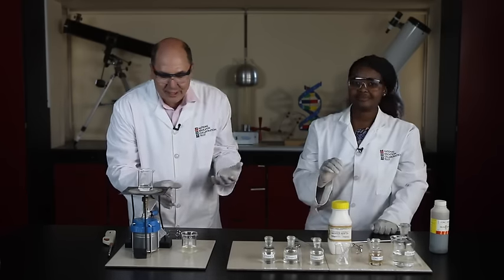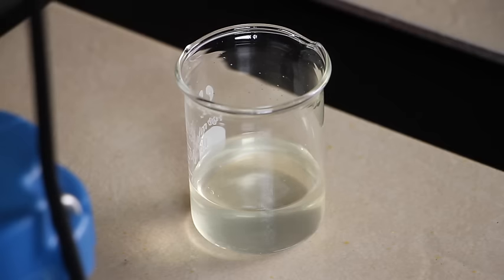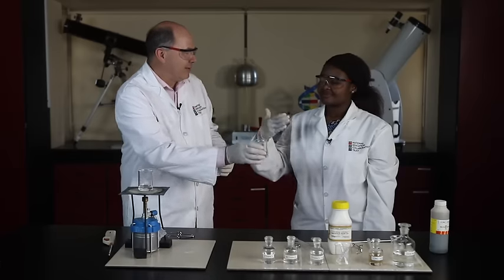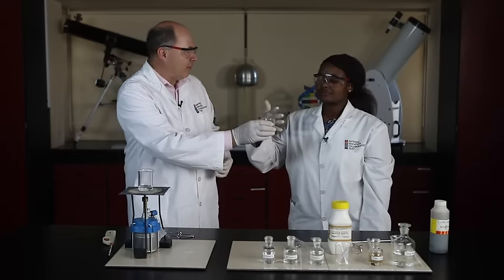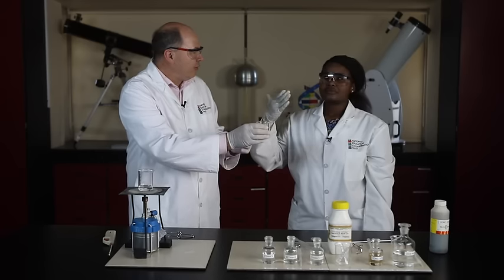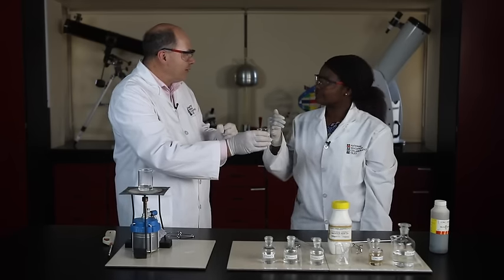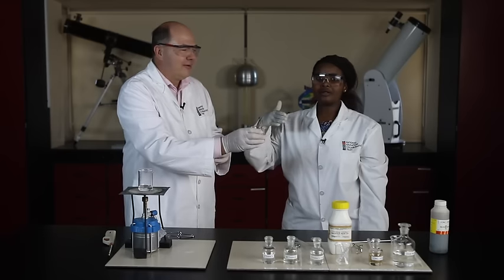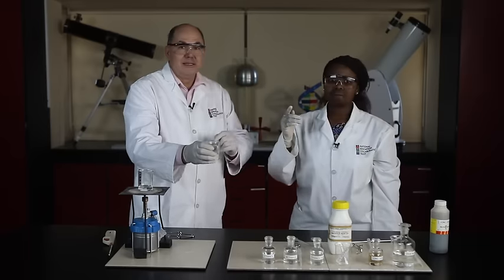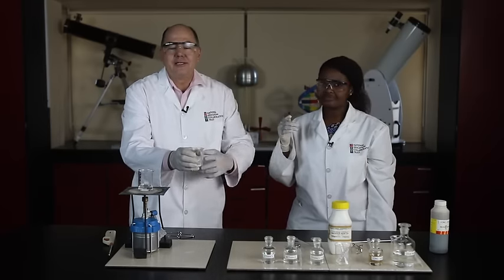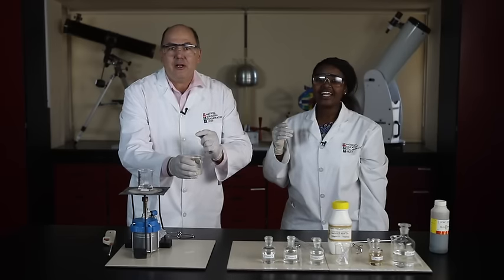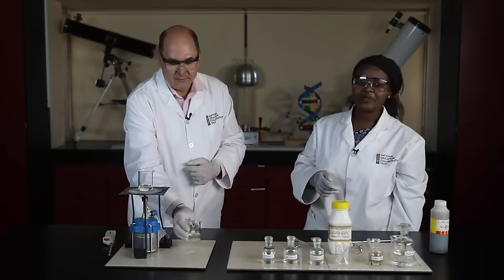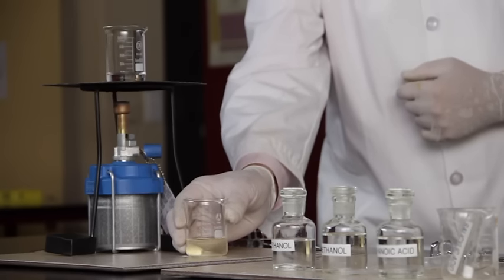Now Joyce, there's no need to let it stand for a short while. I can smell something. Wow, have a waft. What fragrance? This ester has a very distinctive smell. You know what it reminds me of? What? Athletes, the change room. Oh, is the one that we use to treat sore muscles. That's right, as well as sprained ankles. That's right, it's called wintergreen. This is a very pleasant odor. Learners, record the fragrance of this ester formed by the reaction of methanol and salicylic acid.